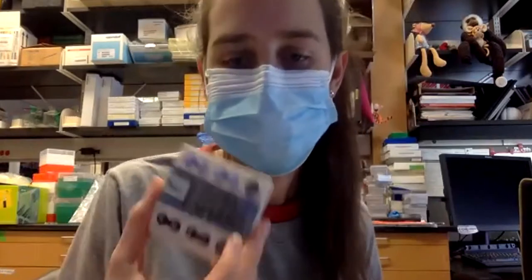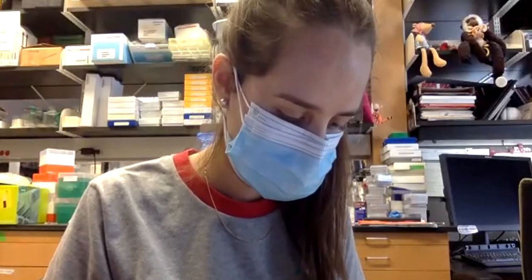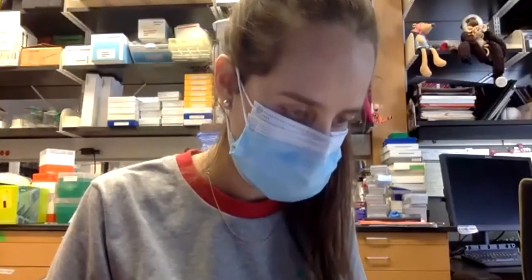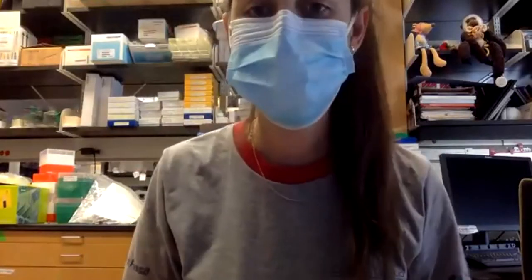Okay, the timer. I'm going to bring the computer closer to the water bath.